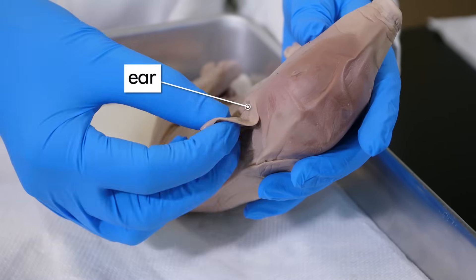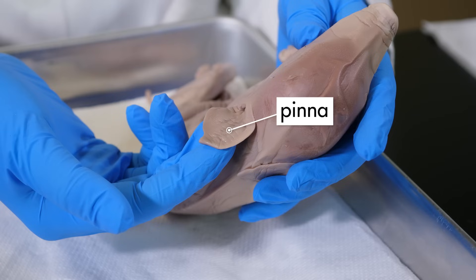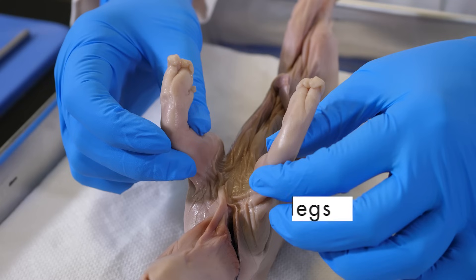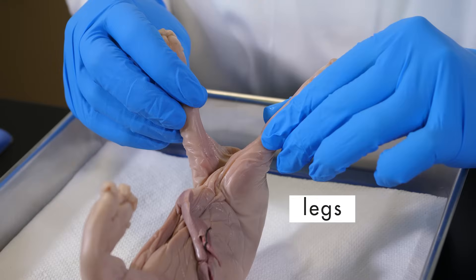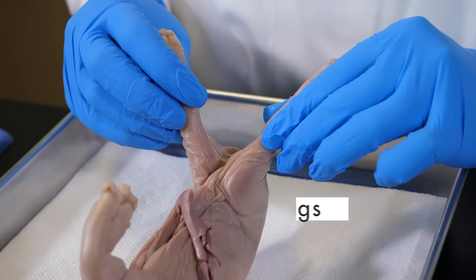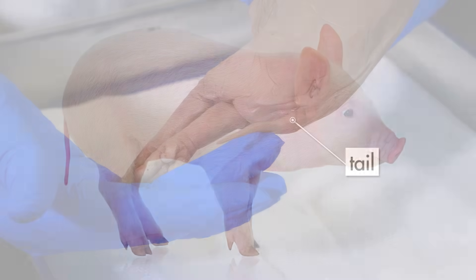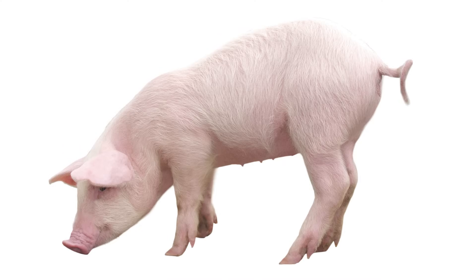Behind the eyes are the ears. This large flap of the pig's outer ear is the pinna. Like most mammals, the pig has four legs. The four legs are about the same length, because this mammal was created to walk on all four legs. Its posterior end is a short tail. Some pigs have straight tails, others have curly tails.